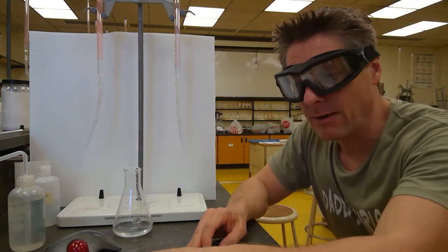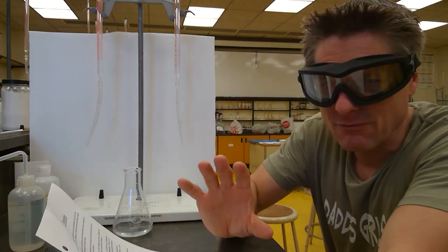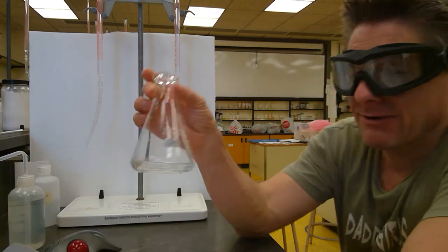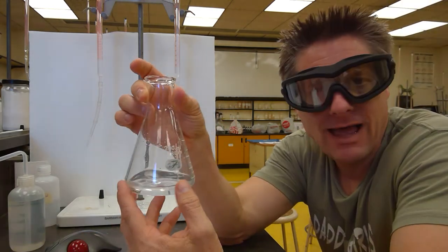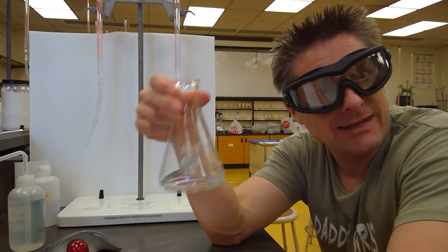I always do that before I record my initial burette reading there. So we're not going through burette techniques. I'm assuming you've already watched that video and used burettes before. And again, get your acid in here. If it's a solid, dissolve it up. Add the indicator. If it's a solution, just add the known volume, add the indicator, and you're good.